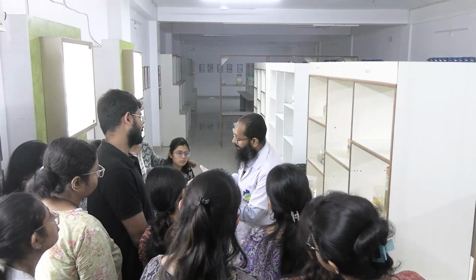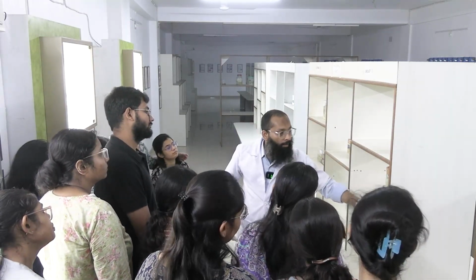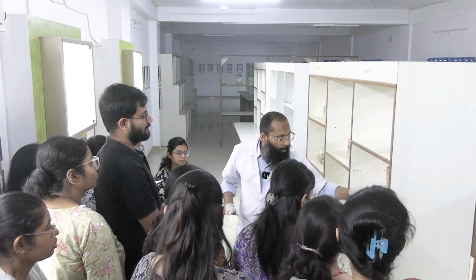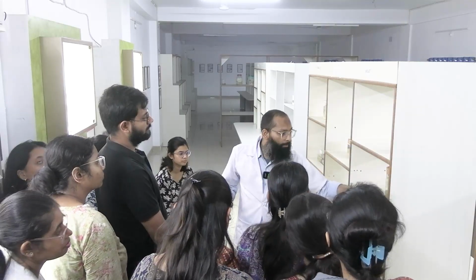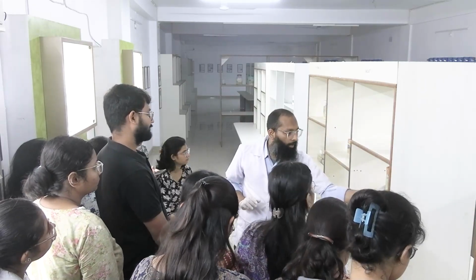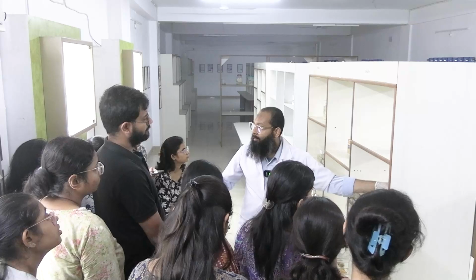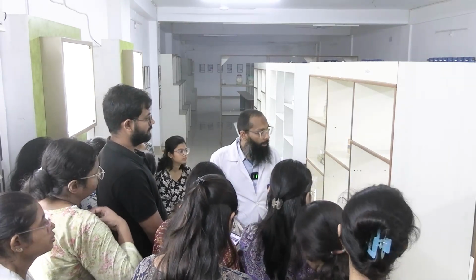ধরো এইরকম টিউমার এখান থেকে কেটেছে, এই জায়গাতে তো টিউমার আমি দেখতে পাবো, ঠিক আছে? So these resection margins are very important. We call it inferior resection margin, medial, lateral, superior resection margin, and the deep resection margins are taken. Okay, a representative section is taken. So this is the first 4 or 5 sections which are being taken out.